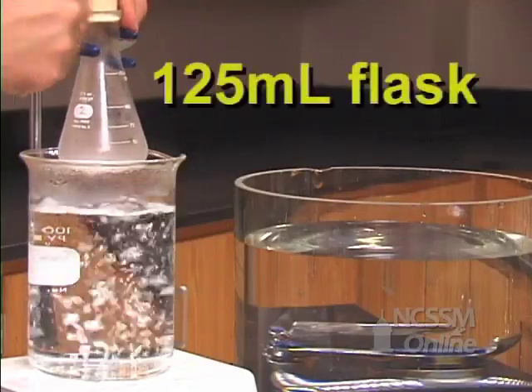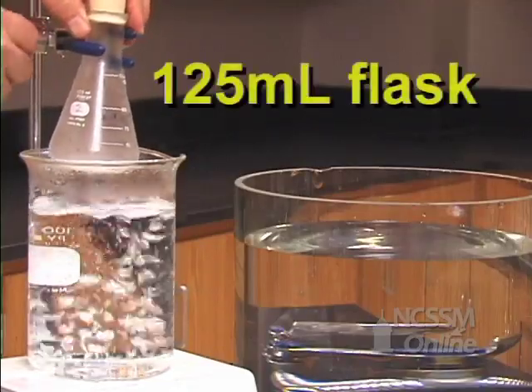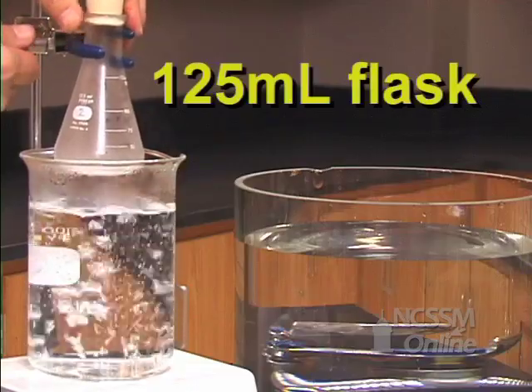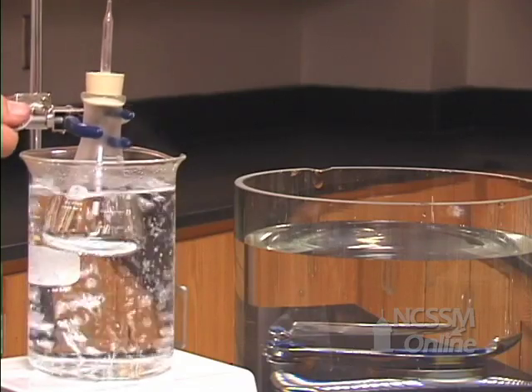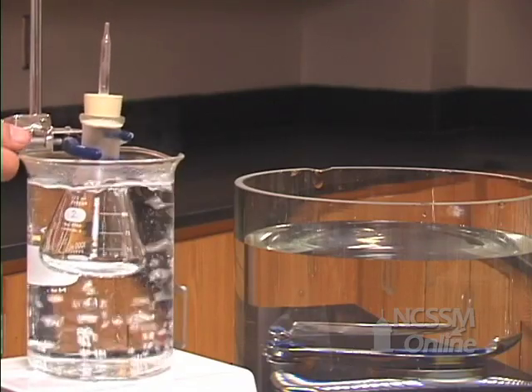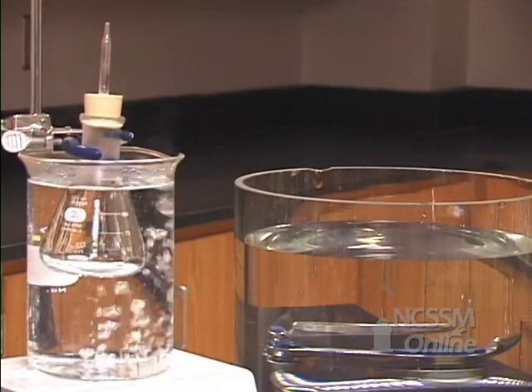We will take the 125 milliliter flask and place it in a boiling water bath. We will wait for a few minutes so that the gas inside the flask reaches the same temperature as the boiling water bath.